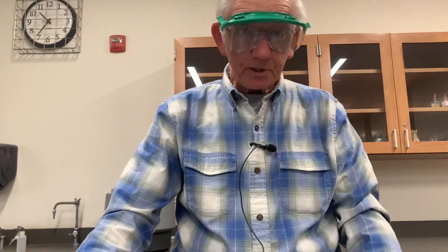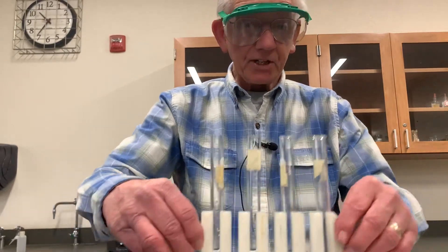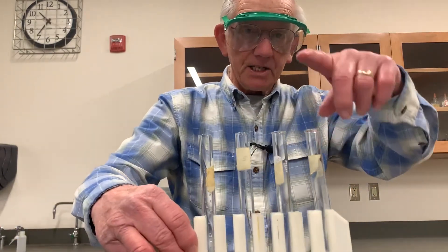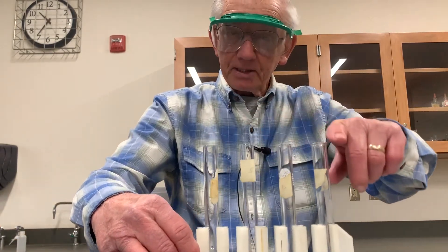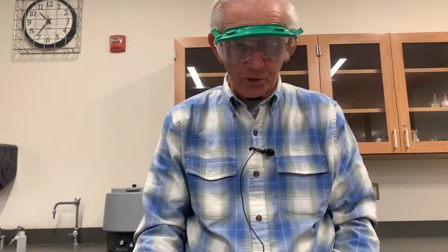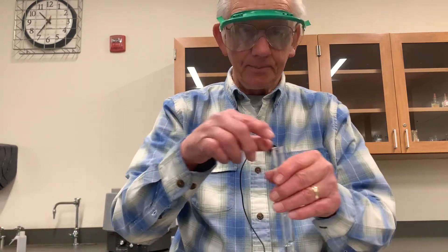Okay, here we go with experiment seven. I've got a test tube rack, with test tubes of magnesium, calcium, strontium, and barium. I'm going to test each of those with the first of the anions, the chromate ion.